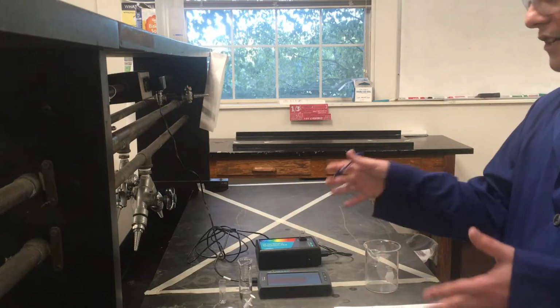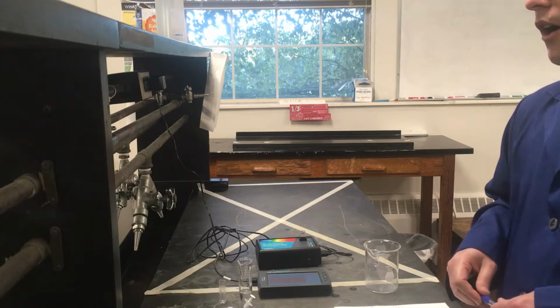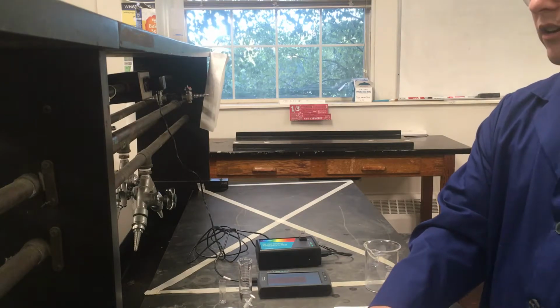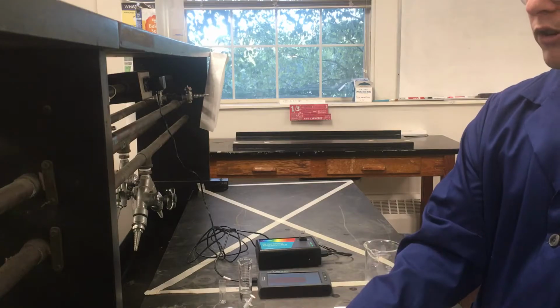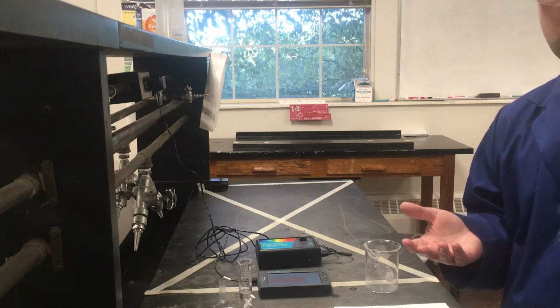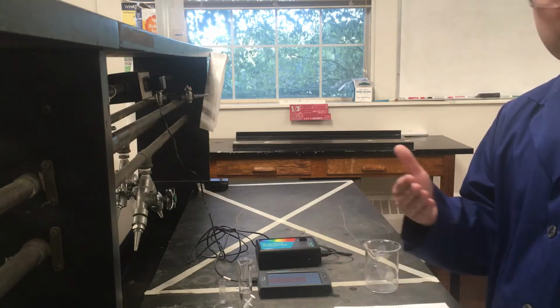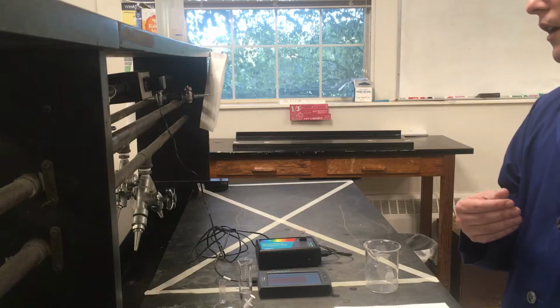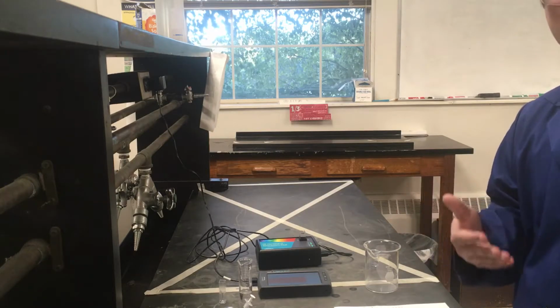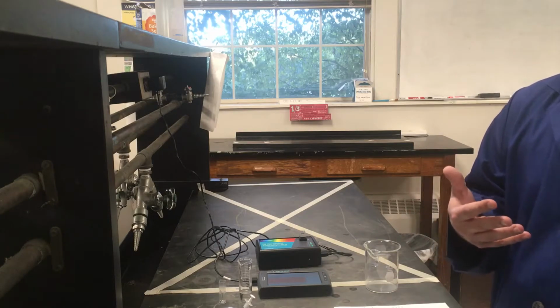But before we go to do any of the measurement portion with our spectrophotometer, our starting point is doing that dilution, so that our crystal violet solution is not so intensely dark that the light doesn't pass through it at all. That wouldn't be useful for relating concentration and absorbance for this compound, because it has a really high molar absorptivity. It absorbs a lot of light in the areas where it does absorb light.